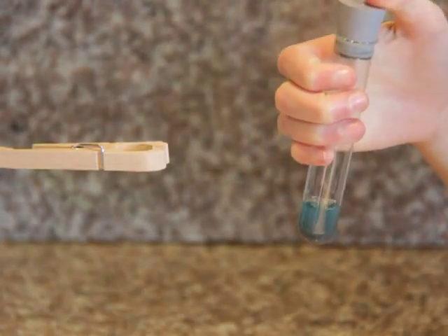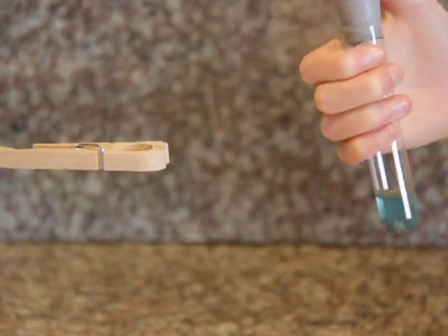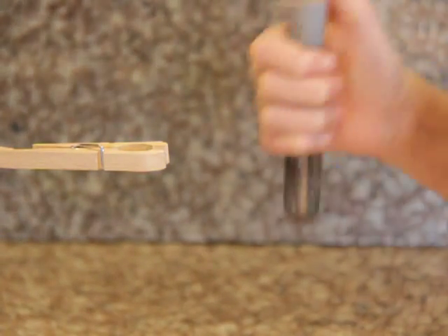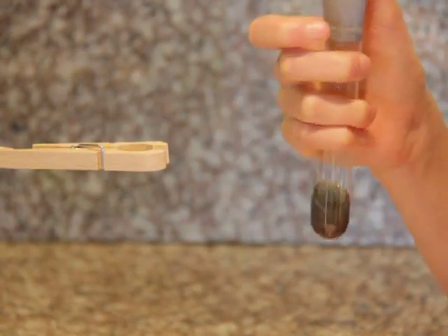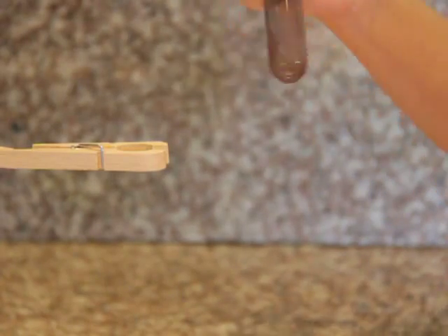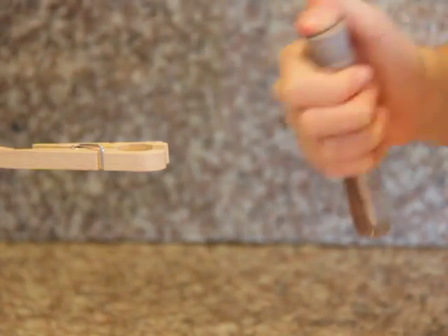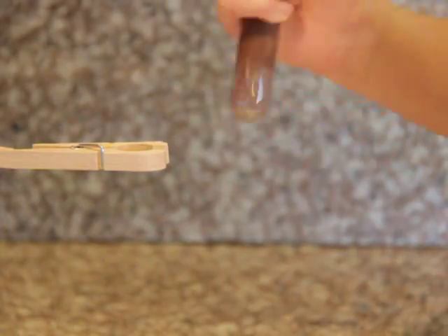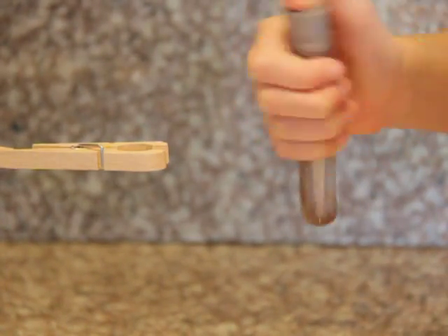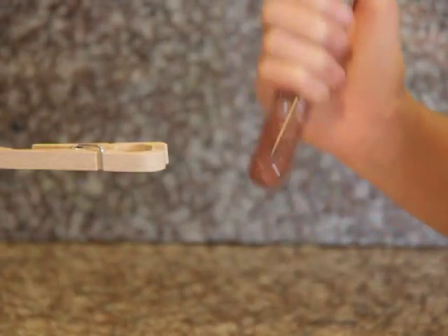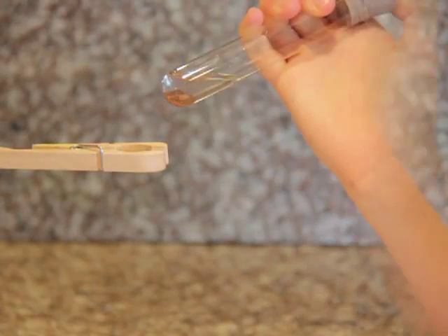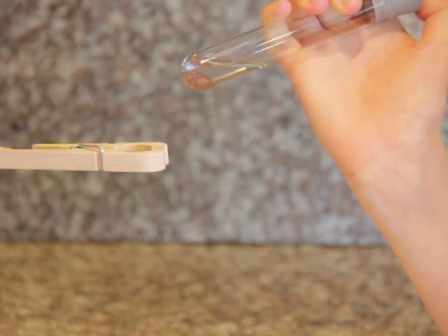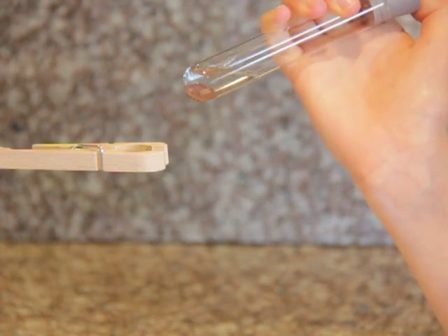Interesting. Here we go. Iron filings have become covered with a red copper coating.